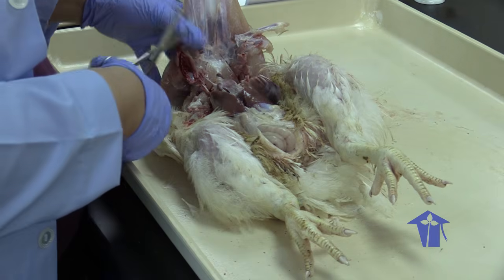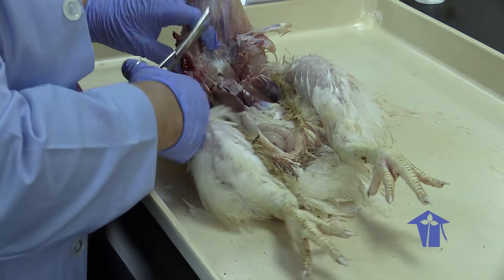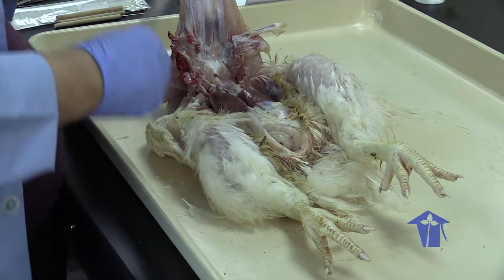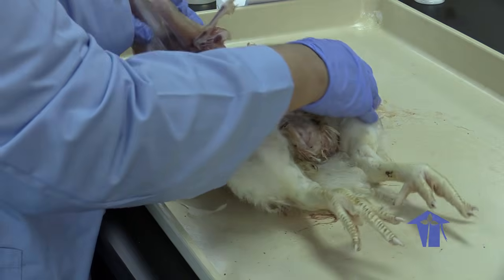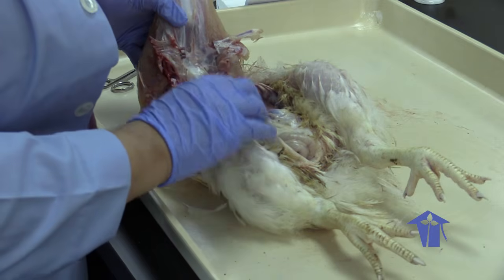It's interesting, and I can make a separation between the science and the grossness of it, but it's not a very easy thing to do.